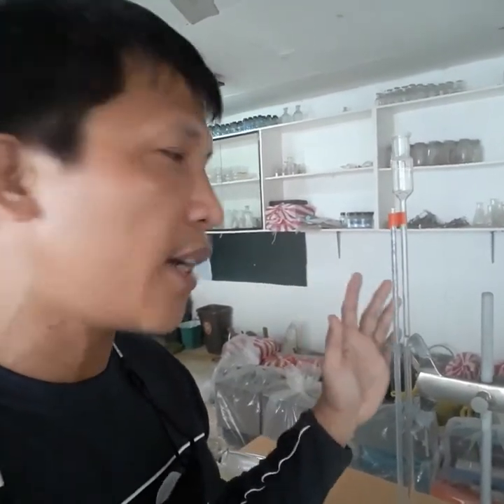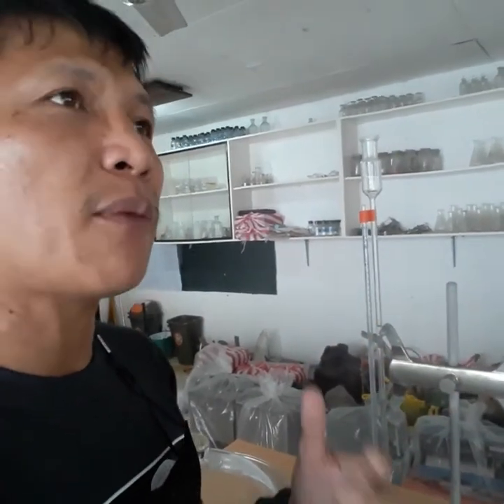Of course, we talk about pipettes, the other one that we have seen so far, the burets, and for macro measurements we have graduated cylinders. Other than that, of course, we still have others that can measure volume accurately. As usual from high school, we usually use the graduated cylinder, but it's really not that accurate. Of course, the accuracy just tells us how big the volume is that we're measuring. For graduated cylinders, of course, it's for larger volumes.